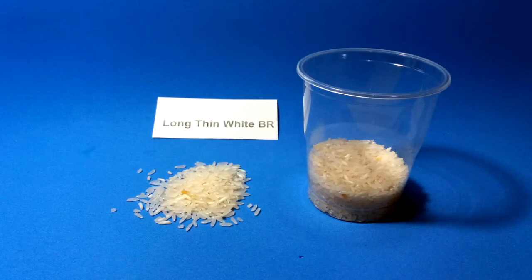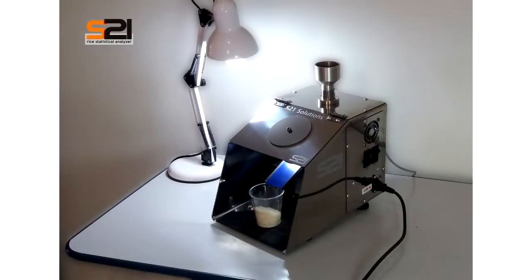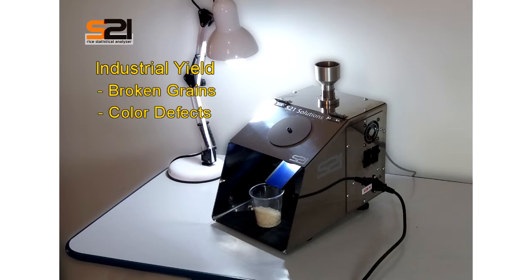For this video, we're using a sample of the Brazilian long thin white rice. The goal of this analysis is to find out the industrial yield rate of the sample. The S21 system will simulate an industrial process by getting the broken grains, color defects, chalky, and center chalk rates out of this sample.